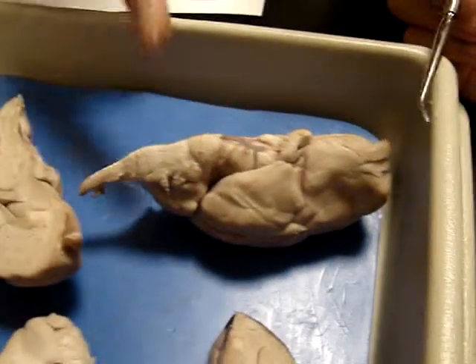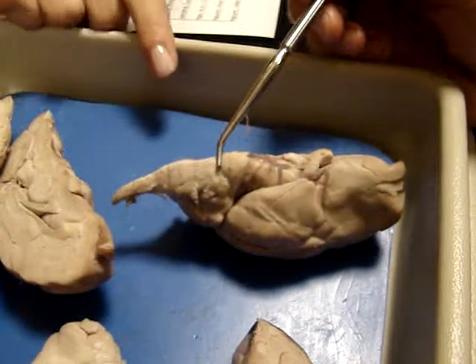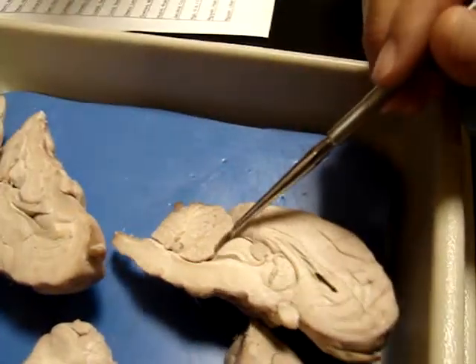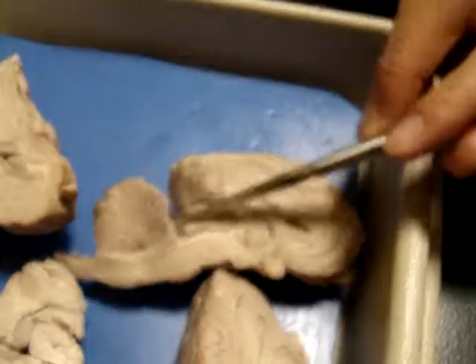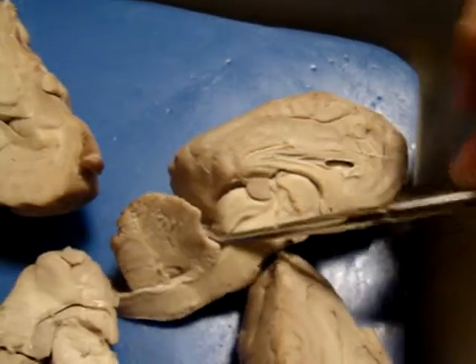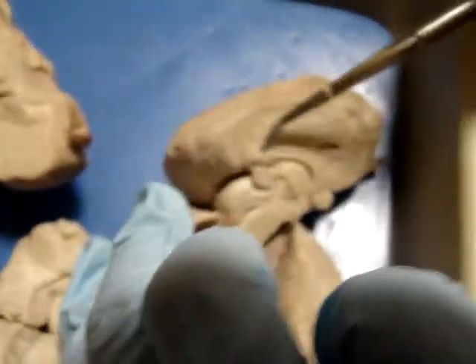What else? If we lift the part above the corpus callosum, we can see them better. You can look inside there. This is the dorsal surface, so if you hold this apart, superior, inferior, here are your corpora quadrigemina from this view.